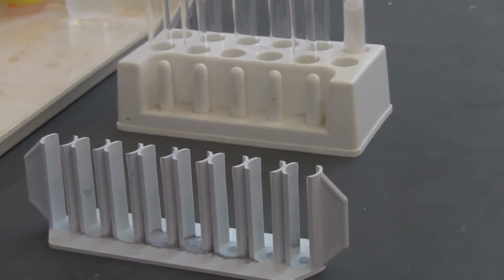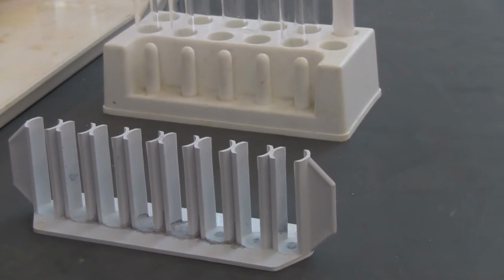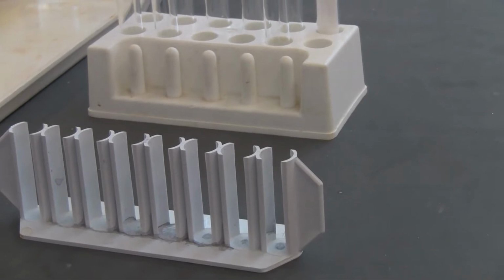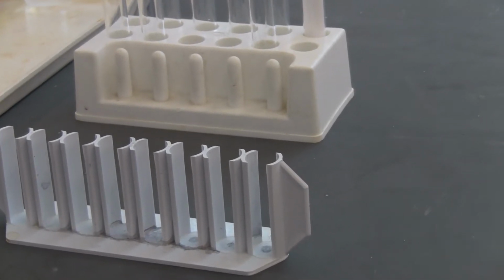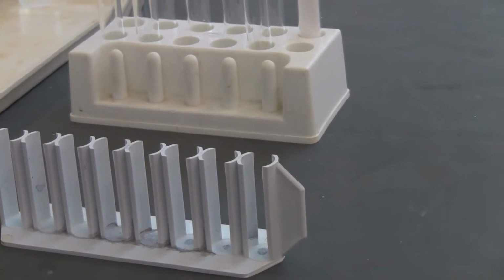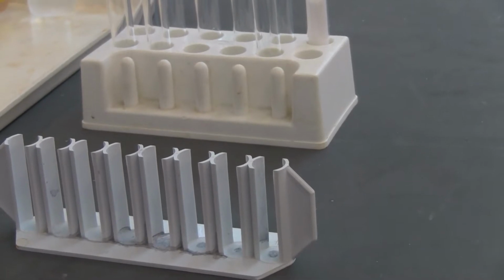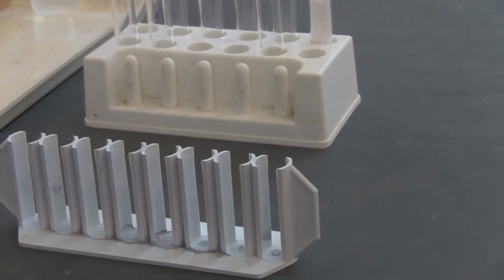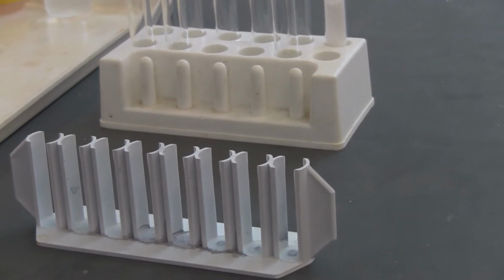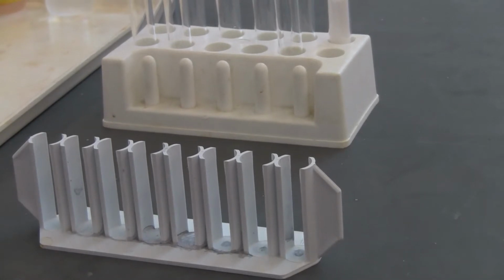I'm going to show you different conditions, and you can see the reaction rate by watching the reaction. In this case, it's the bubbling because gas is forming. You're going to see if the bubbles form violently or slowly to decide if the reaction is faster or slower under different conditions. The first factor we're studying is the nature of the reactant.